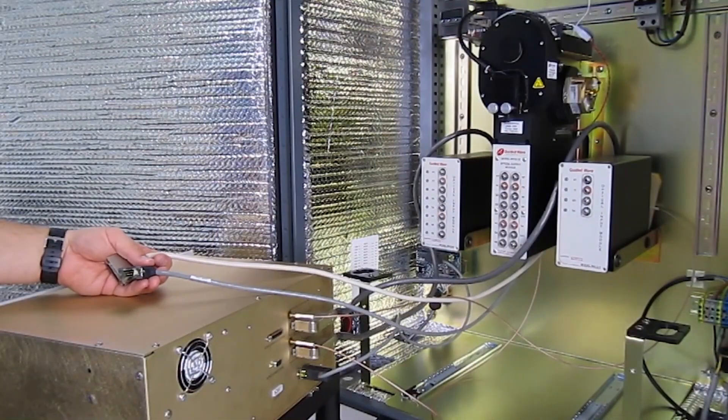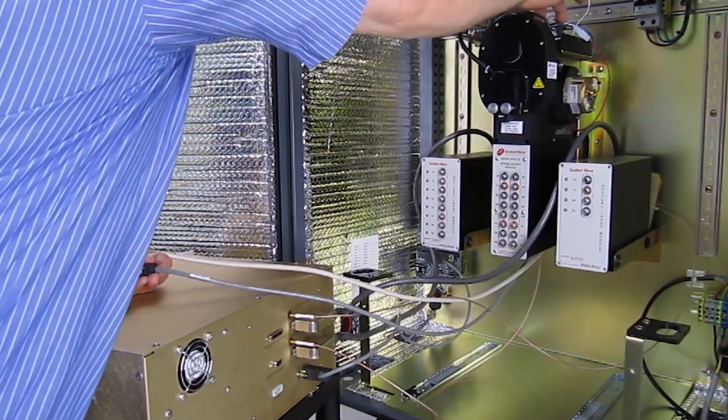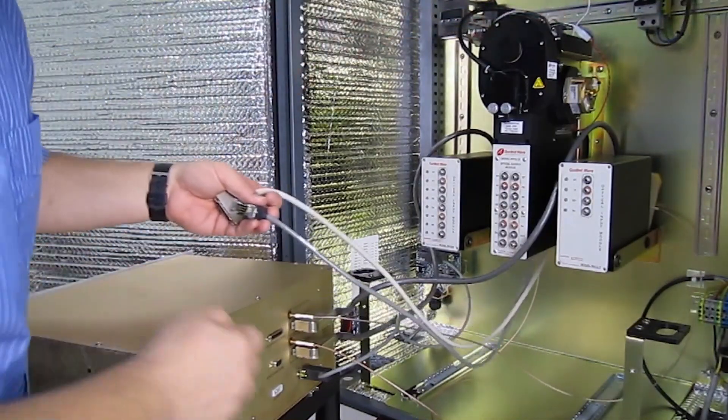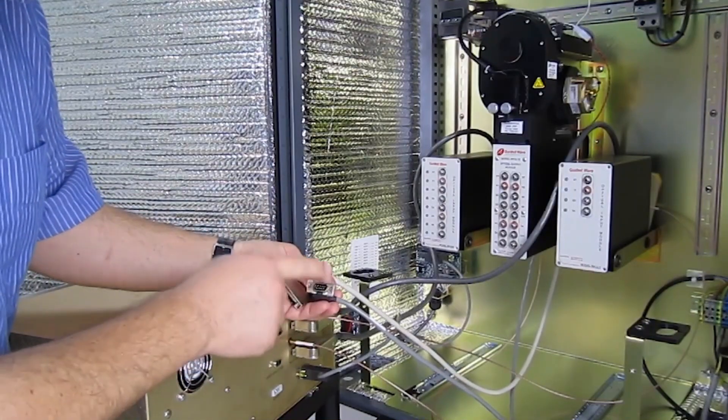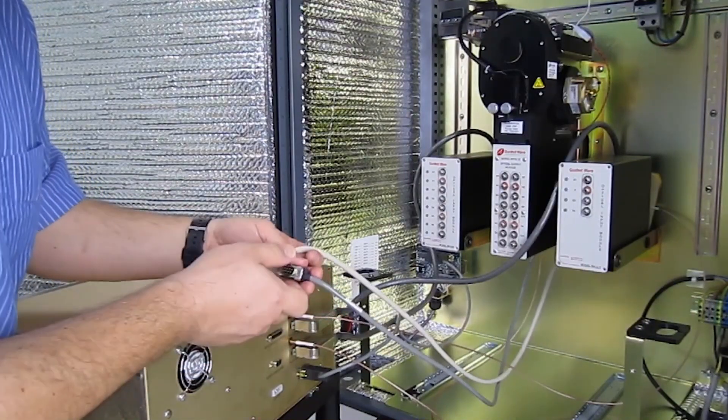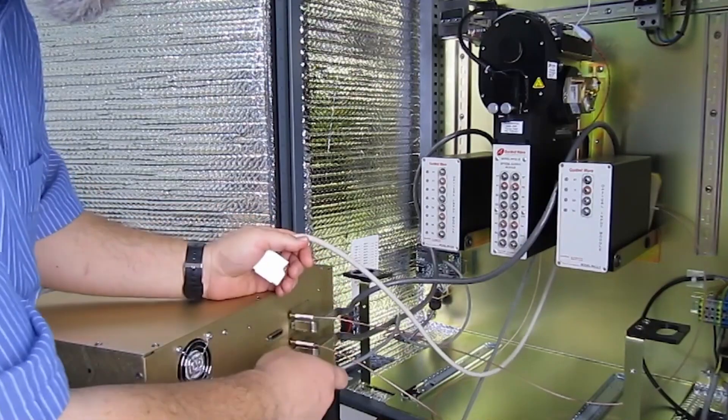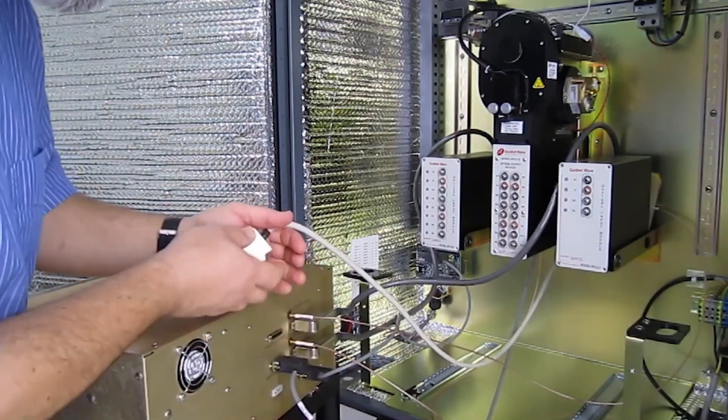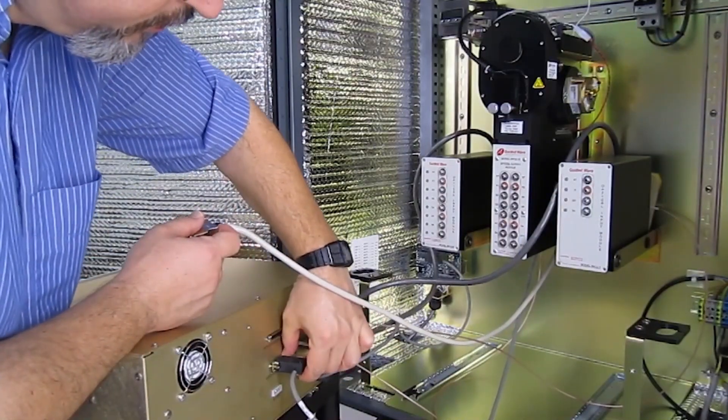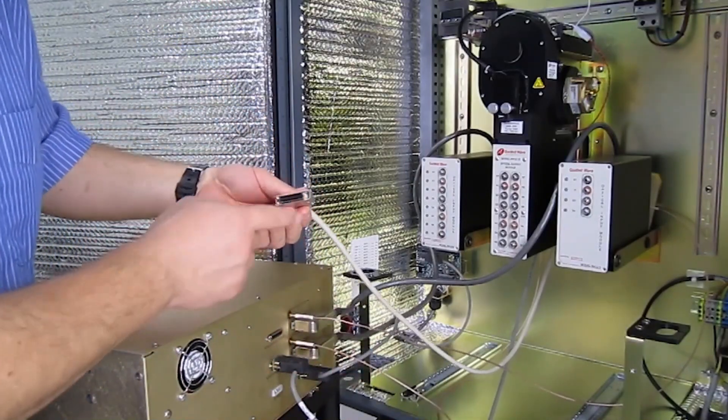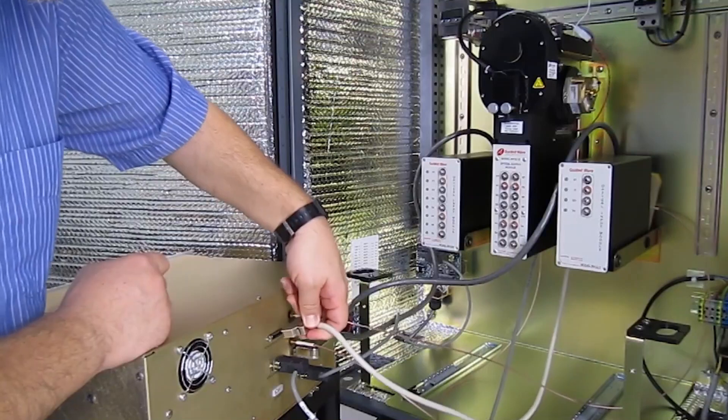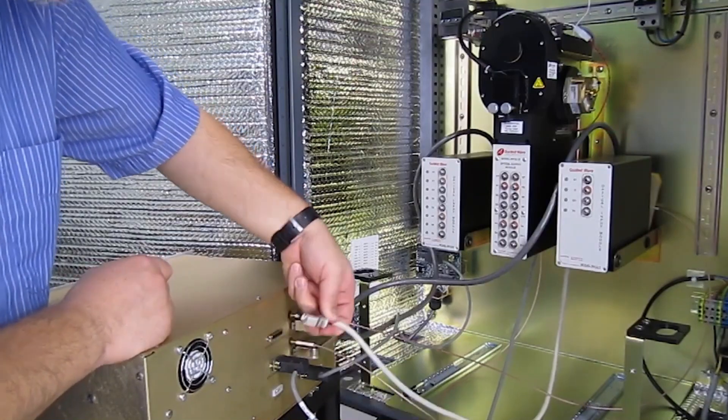And connecting the two cables from the top of the monochromator, they'll plug in here and here. First I make sure this is in the unlatched position, plug it in, latch. And latch this one has the latches ready to go just by pressing it into place.